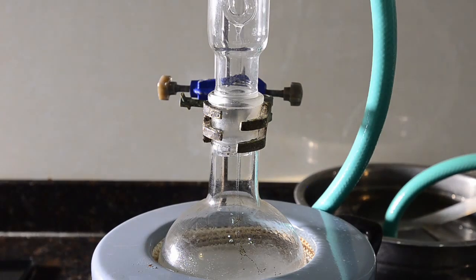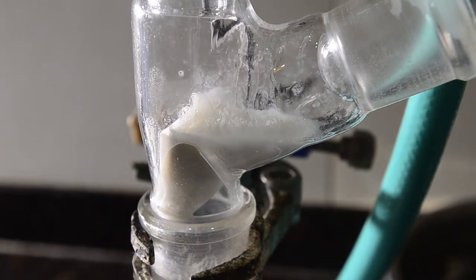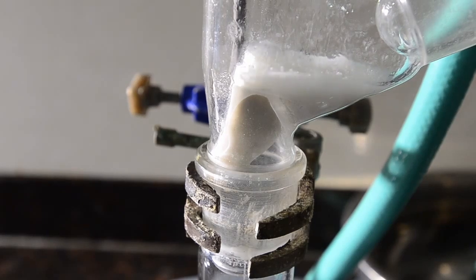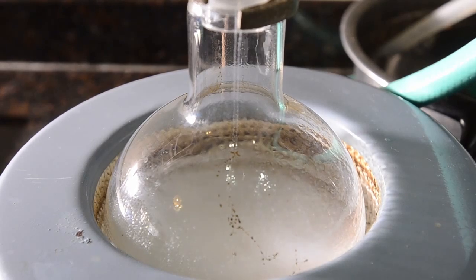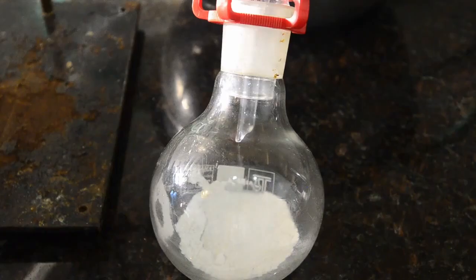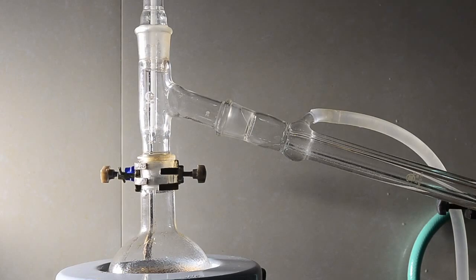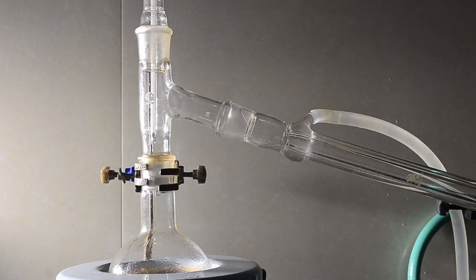After an hour we tried again using a different configuration of filter paper and with the calcium oxide packed down tightly. But this also overflowed after a while. So at this point we tried a different approach. After another 30 minutes of normal refluxing, we set up for simple distillation, only using calcium oxide in the receiving flask. We figured we'd collect the ethanol and water azeotrope and then try to dry it using the calcium oxide before returning it to the boiling flask.